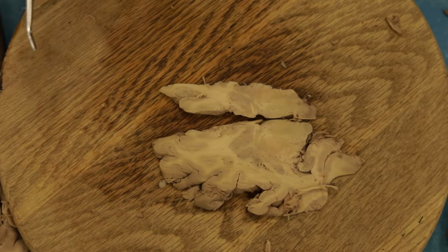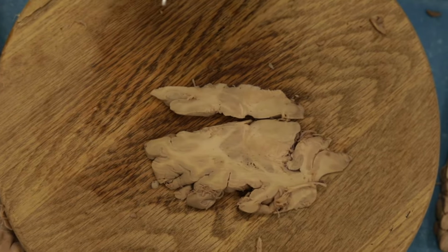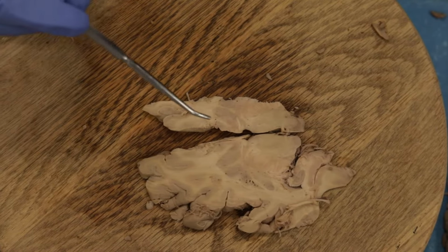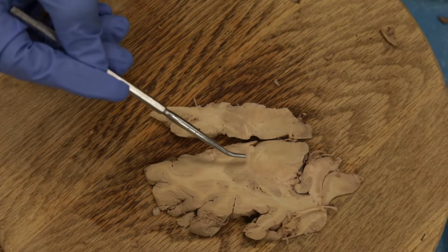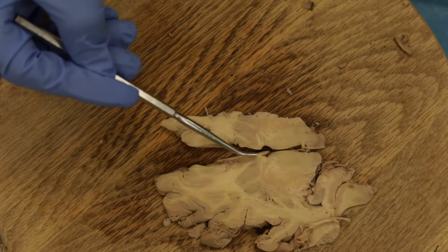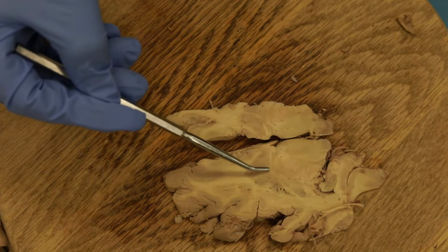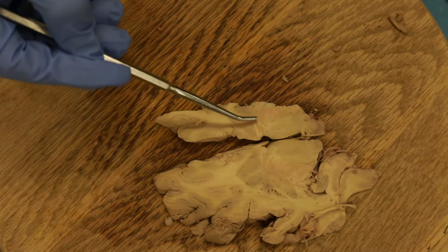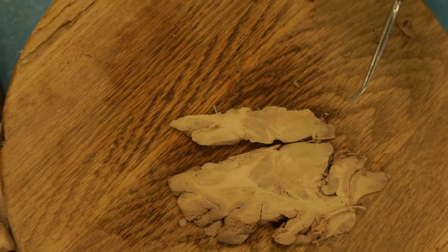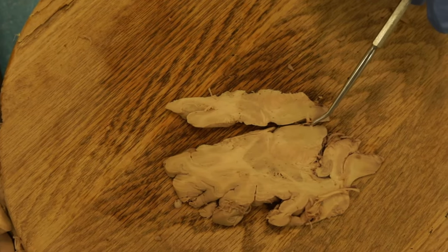So there's just a couple things to point out. I did a really thin cut here because I wanted to try to catch the anterior and posterior commissure. So anterior commissure is always really distinctive. You'll not see anything else like this. Okay, where it crosses straight over the midline like this. Okay, so this is the anterior commissure, and we can actually see back here the posterior commissure.